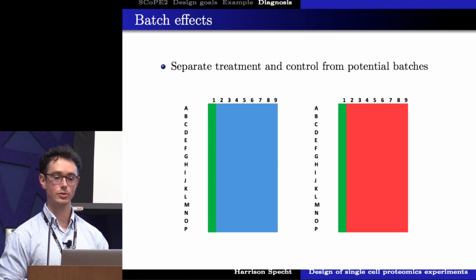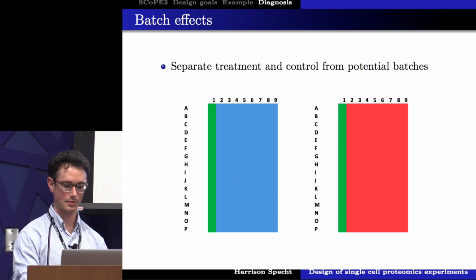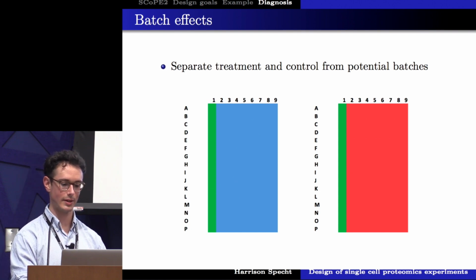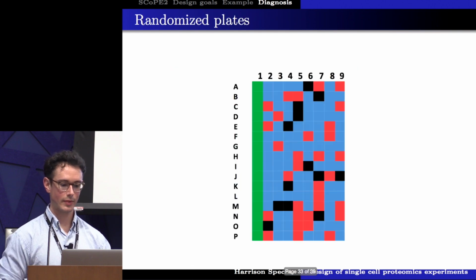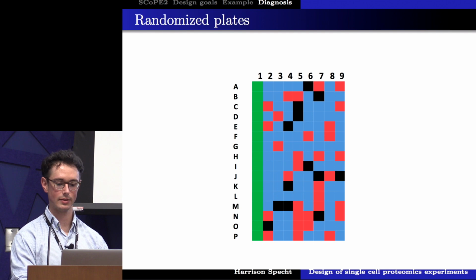So we never want our treatment and our control conditions to correspond or correlate to any potential batches. So here I'm showing 2 really big faux pas where we sorted cells of one type onto one plate and cells of a totally different type onto another plate, and then processed them separately, giving us 2 large batch effects that we would not be able to attribute the signal to cell type or to batch. So the solution to that is fairly straightforward: randomizing on the same plate.